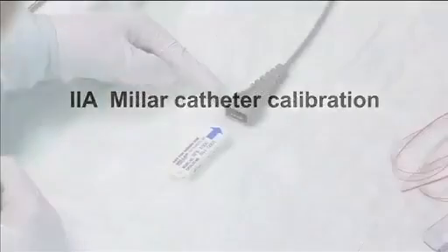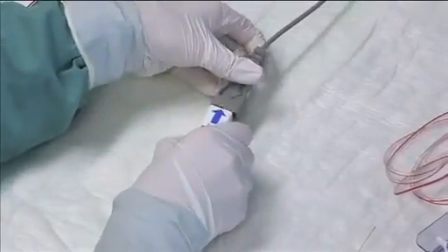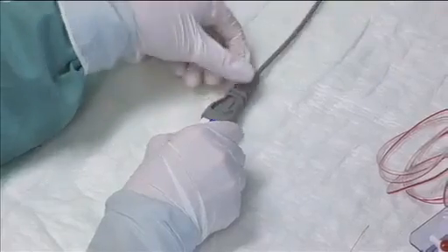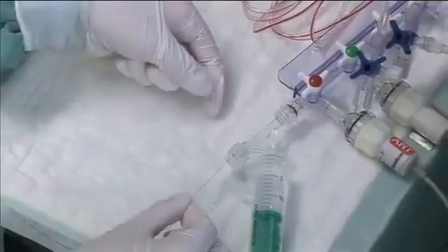Millar catheter calibration. Connect one Millar sensor to the Millar 2 channel, which is set for acquiring portal vein pressure. Insert the Millar sensor tip into water column manometer.